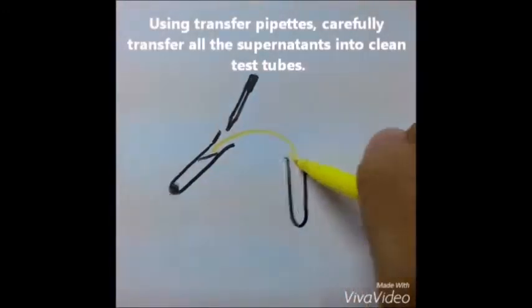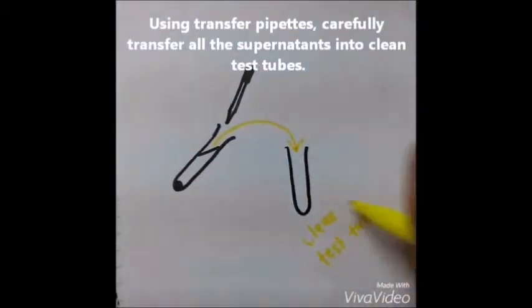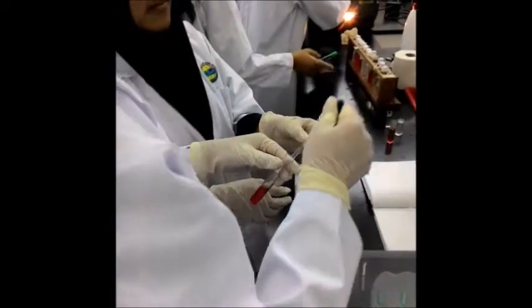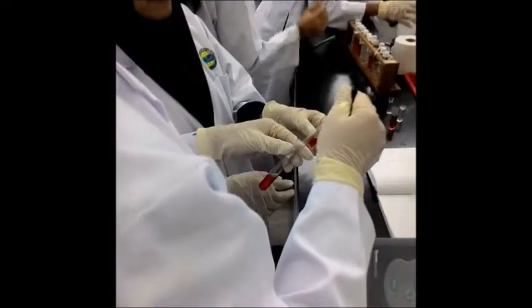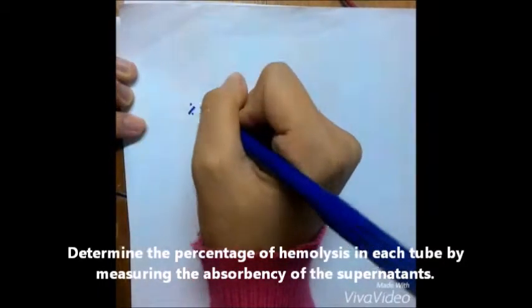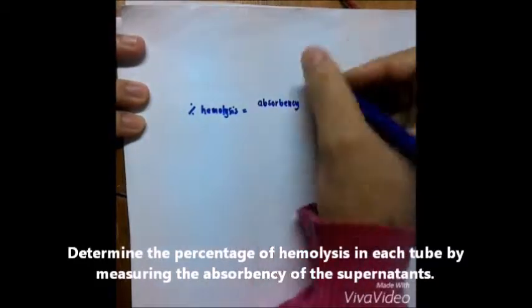Carefully transfer all the supernatant into a clean test tube by using a transfer pipette. Determine the percentage of hemolysis in each tube by measuring the absorbance of each supernatant.